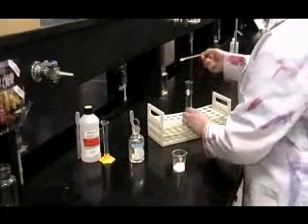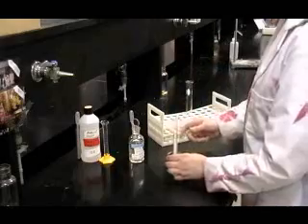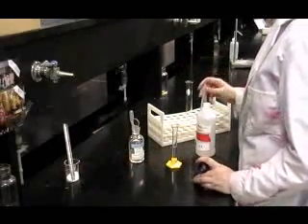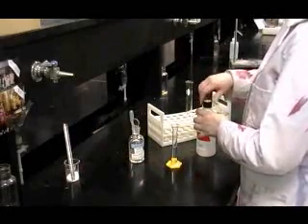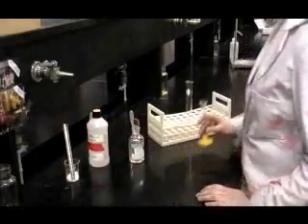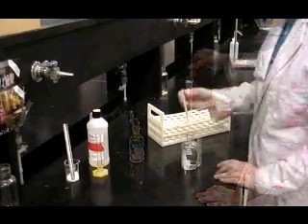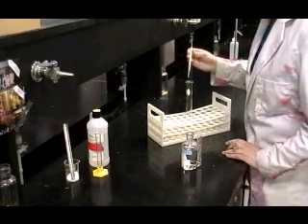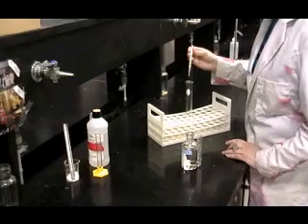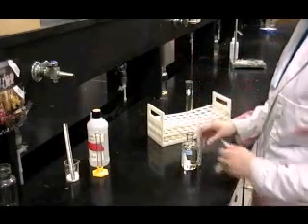While waiting on your water to come to temperature, prepare your reaction by placing a small amount of salicylic acid into a 20 centimeter test tube, about the size of the eraser on the end of a pencil. To this, add about 5 milliliters of methyl alcohol. Then, add 5 drops of concentrated sulfuric acid. Remember, use caution when working with sulfuric acid.